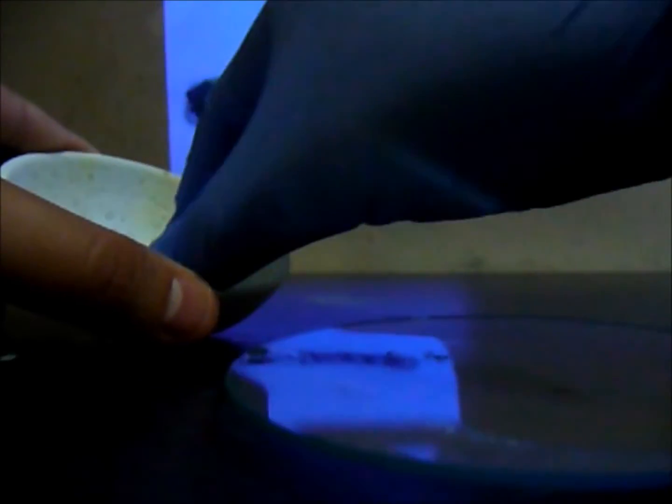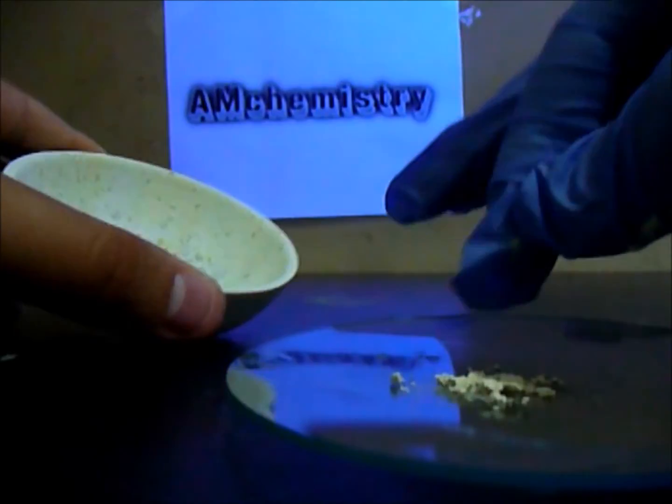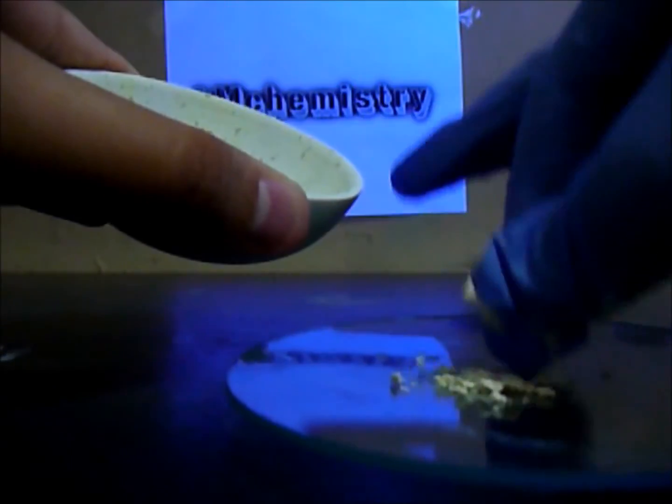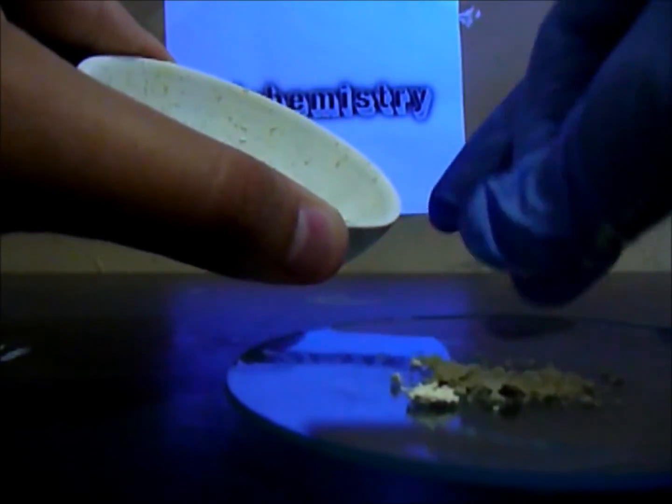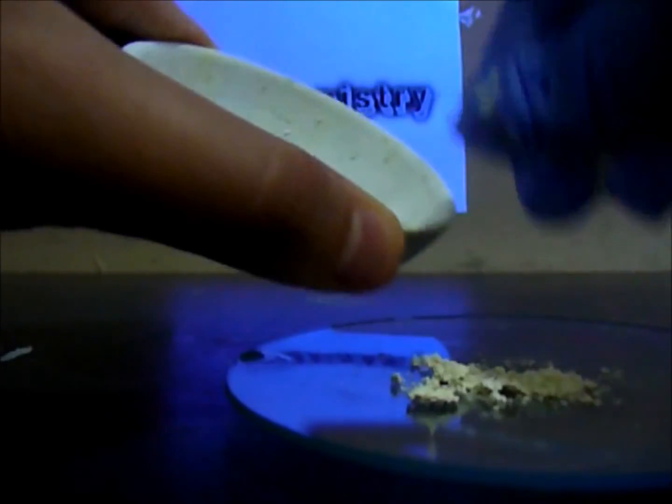So, to extract the most pure material, just get the white or the yellow stuff. It's still kind of hot, but not that much.